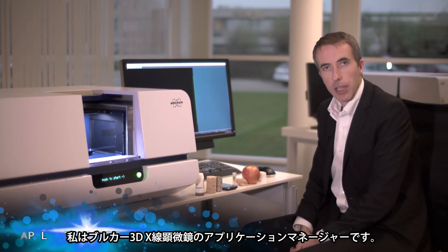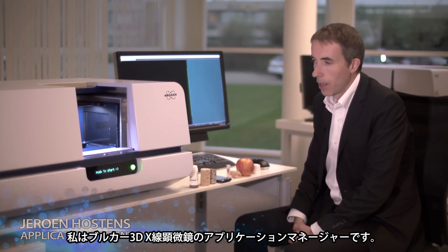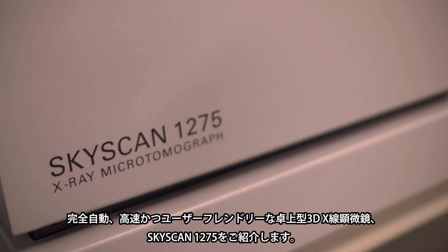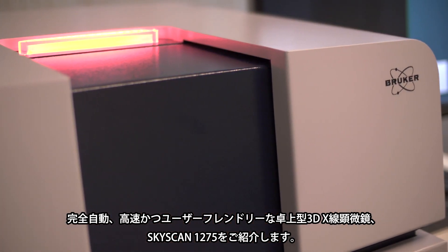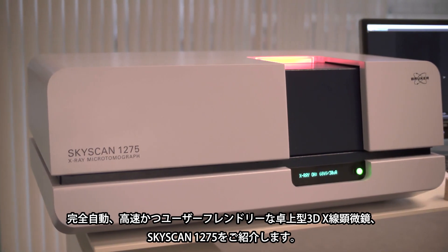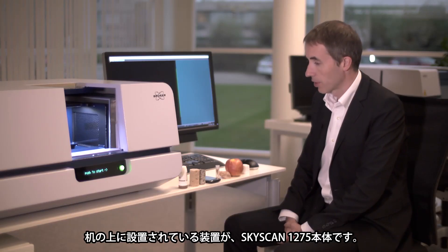My name is Juden Hostens. I'm the applications manager for Bruker MicroCT and today I will be discussing our latest development, the SkyScan 1275, which is the very fast and very user-friendly MicroCT system.